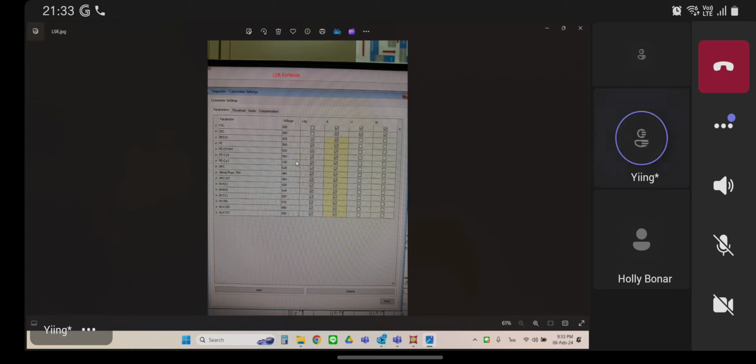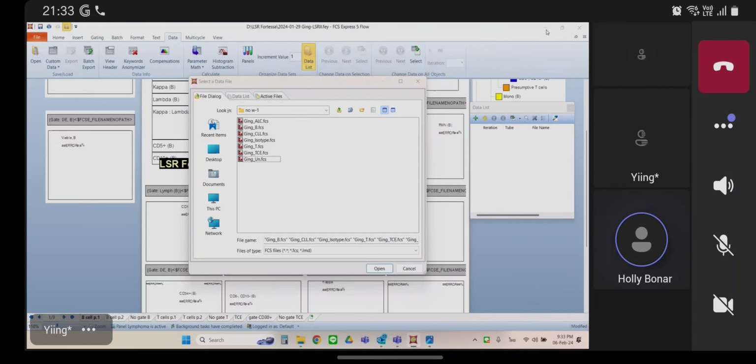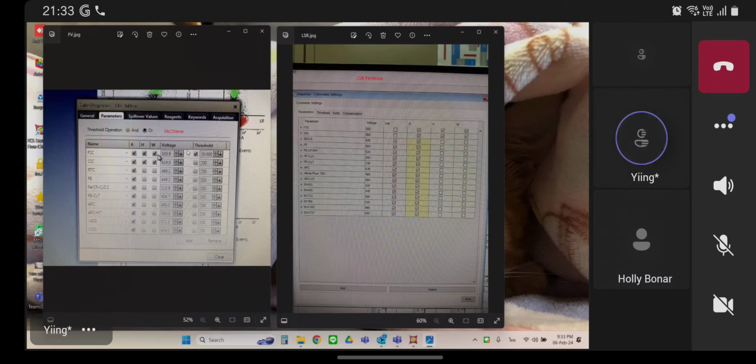I mean, when I save the data, I do not know anything about the machine. I save. Okay. So then you need to fix your layout so that it accommodates all 6 of those parameters, and then use that going forward. All these data sets that we've been using have different numbers of parameters, and you can't fix them because they've already been exported. So it's something that you have to kind of fix going forward. Every day I work with the same FACSVerse, right? Compare LSR to LSR Fortessa. When I save the data, I do not check the parameter. Okay. Nothing. It's the same. I think same FACSVerse, same LSR.